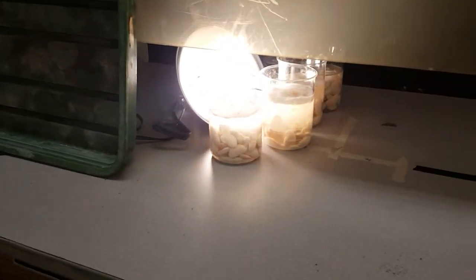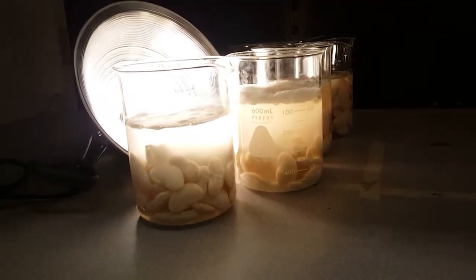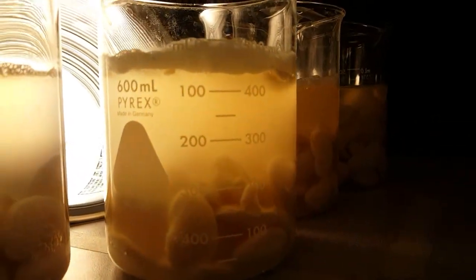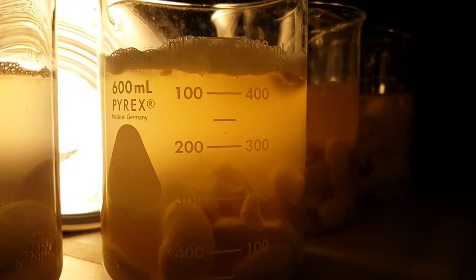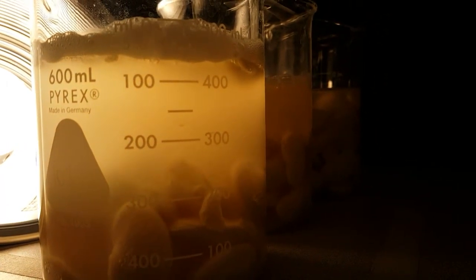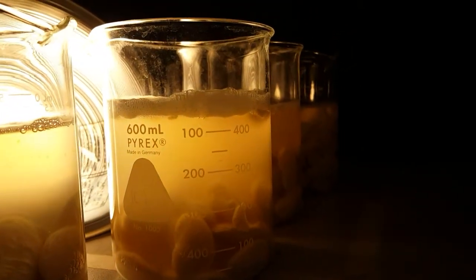Let's check out our lima bean cultures — nice and warm and toasty right next to the light. Remember, we put some store-bought lima beans in water and placed them in a hood specifically to make sure we didn't get any stinkage diffusing throughout the room. If you were to do this at home, you'd want to put it somewhere the odor wouldn't be a problem, and get some help from mom and dad to make sure it's safe with the light.